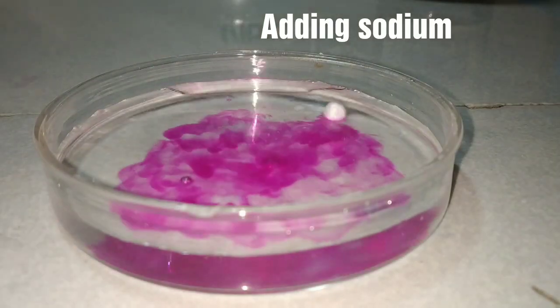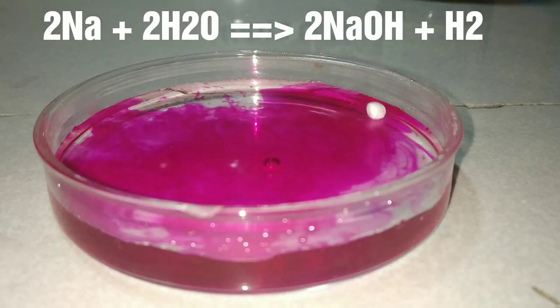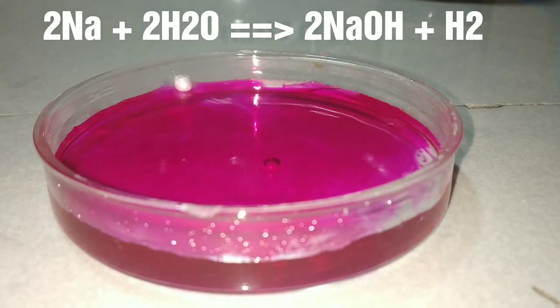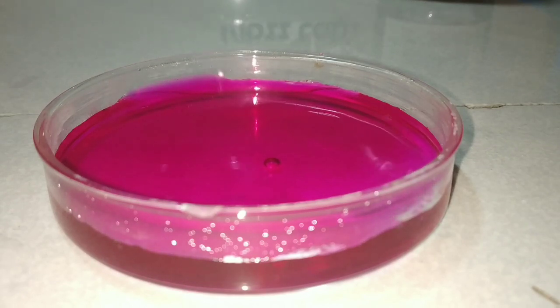On adding a piece of sodium metal into water, you can observe a very vigorous reaction. This reaction is highly exothermic, making that piece of sodium melt, and the color has turned pink. That is because this reaction produces sodium hydroxide and hydrogen gas, and sodium hydroxide is basic, which turned the phenolphthalein pink.